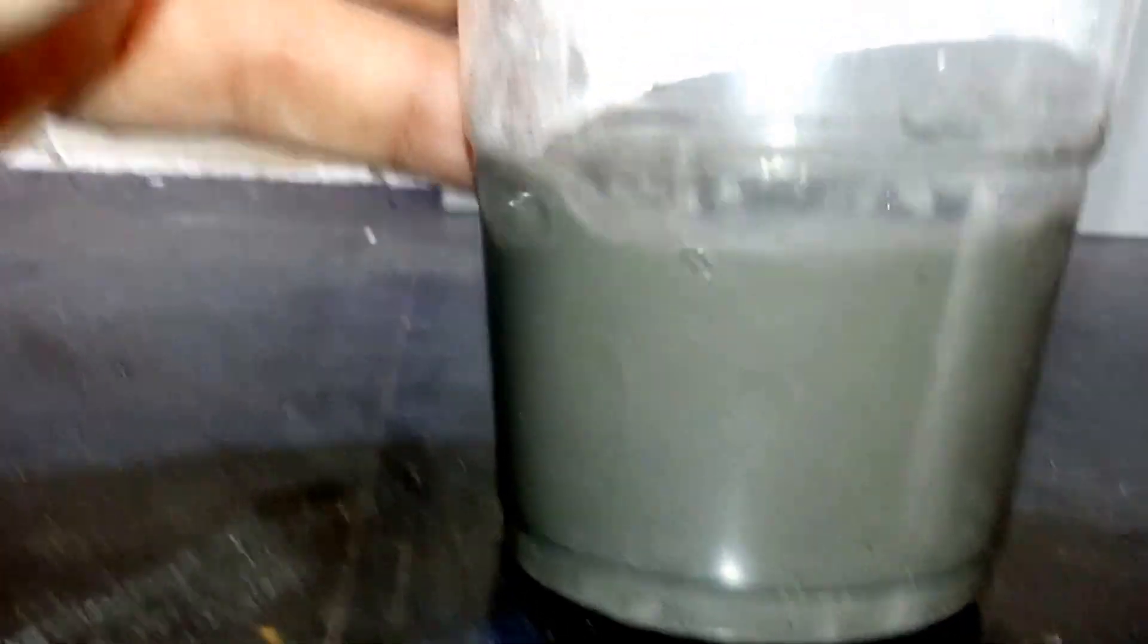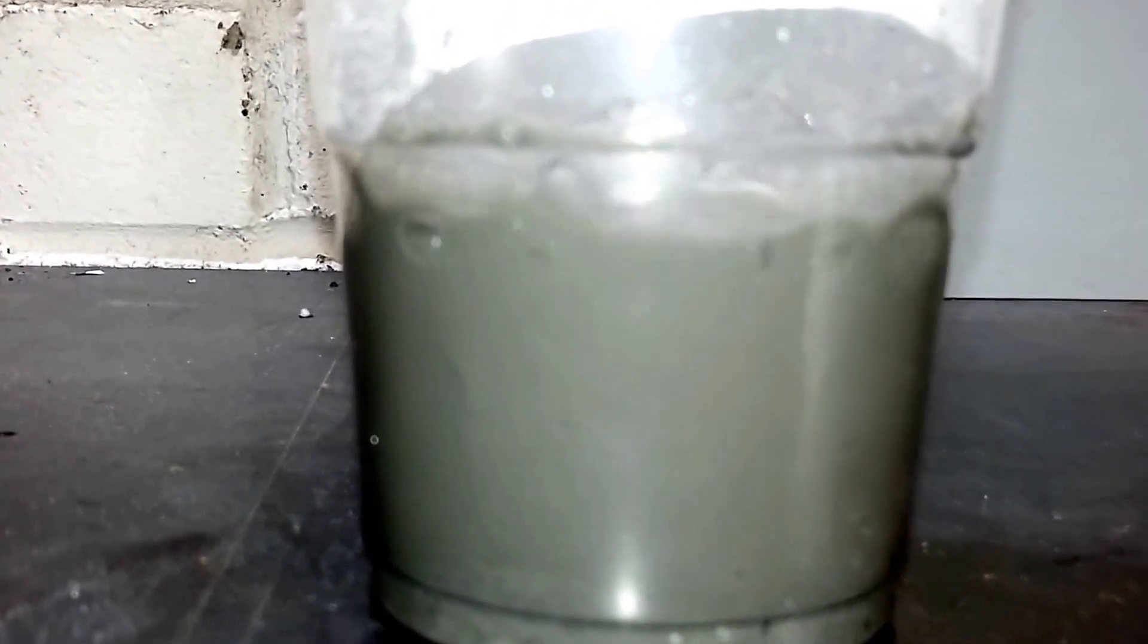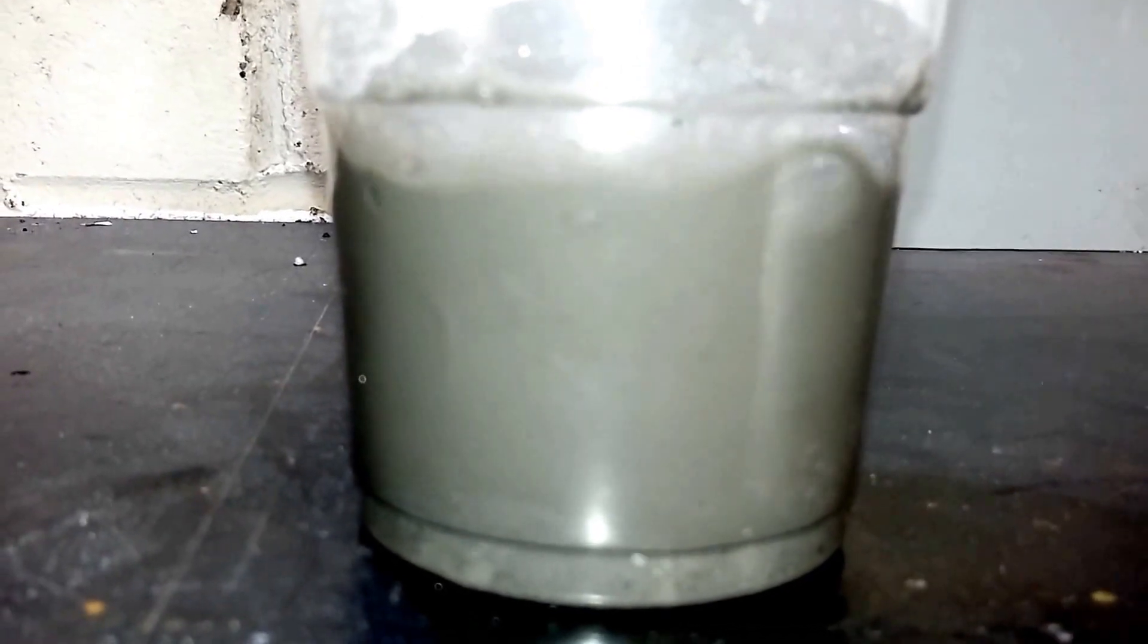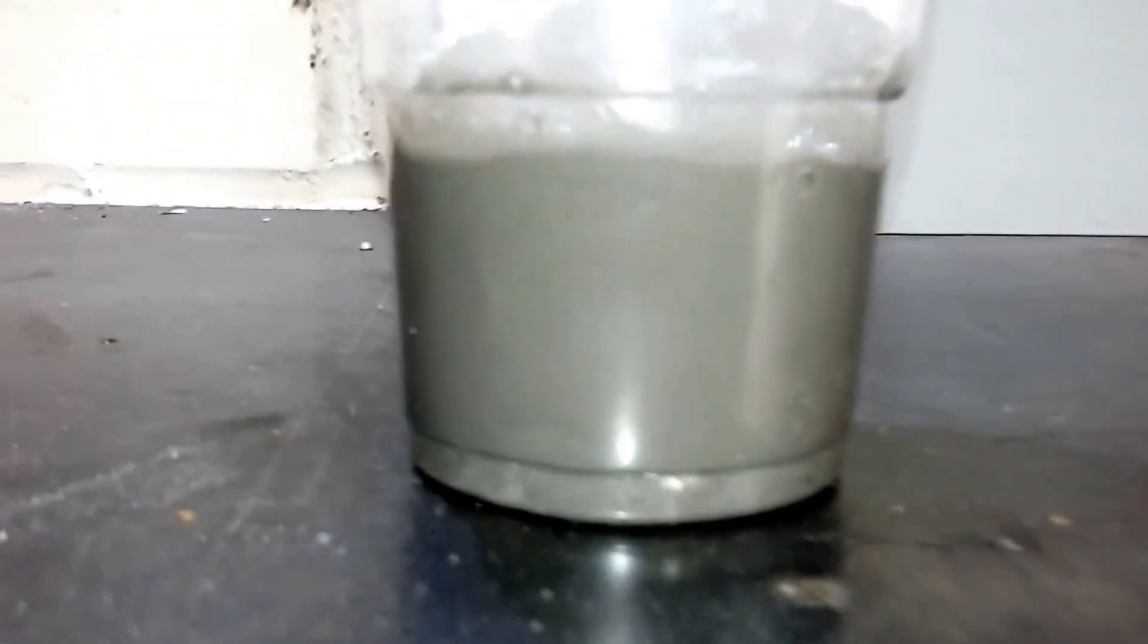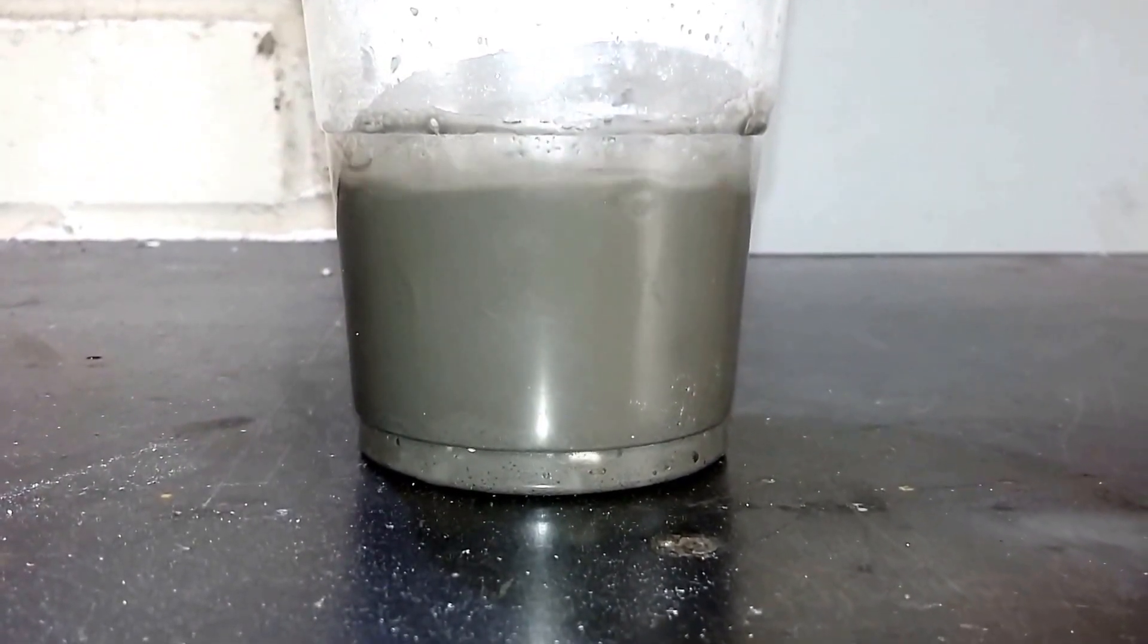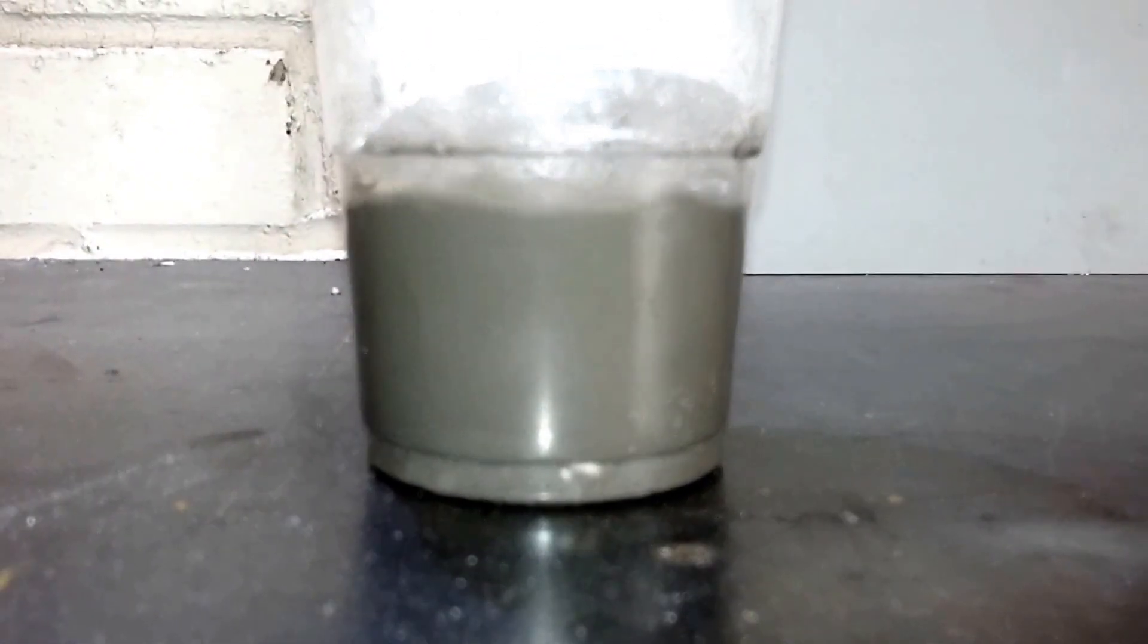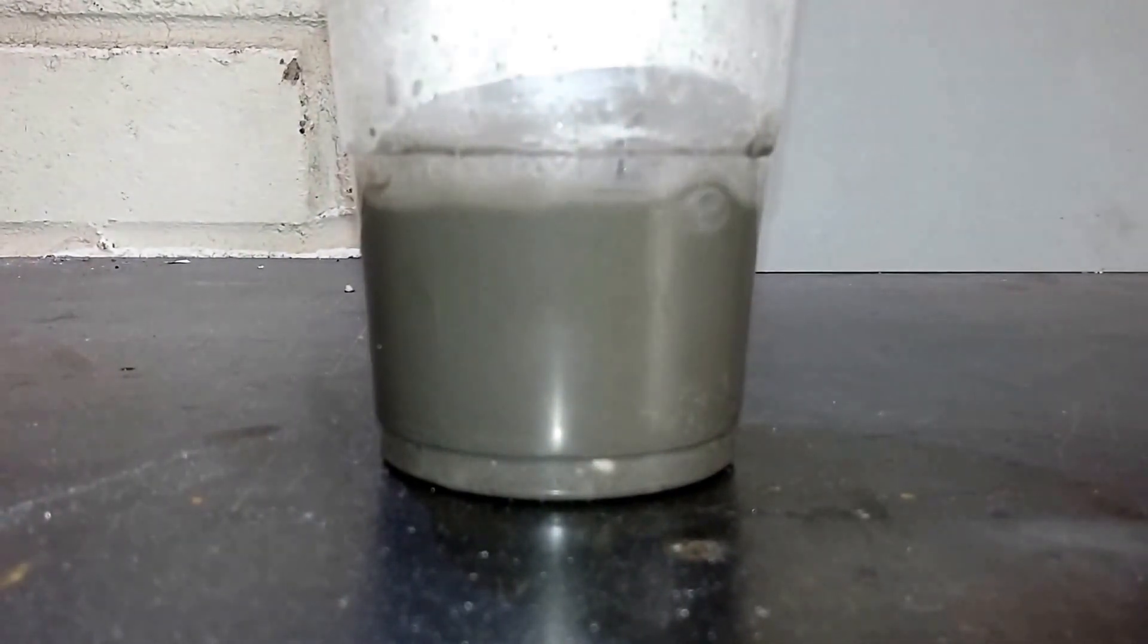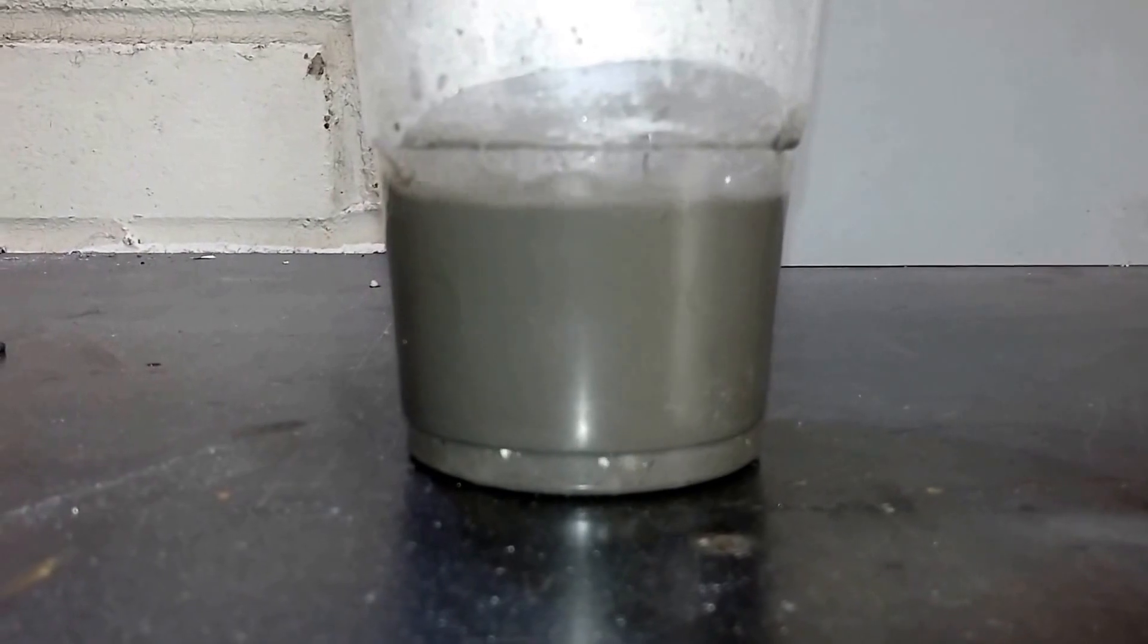It's slowed down now though. I shall pause for a moment, let the reaction carry on and then resume shortly afterwards.